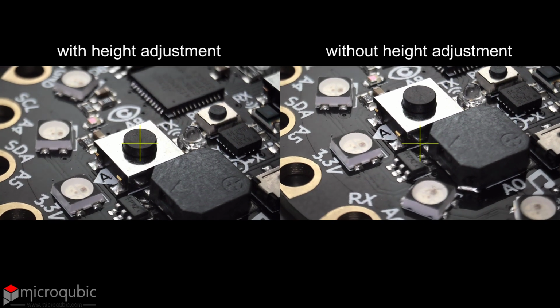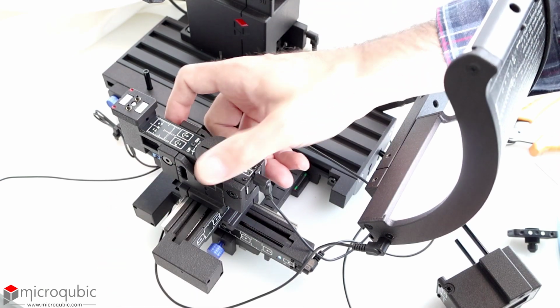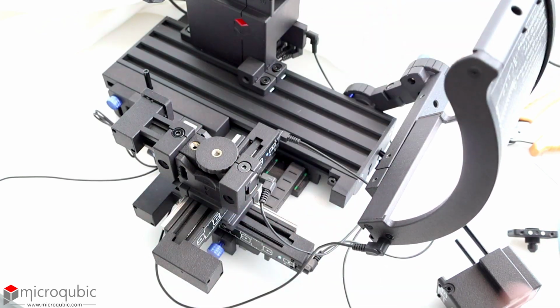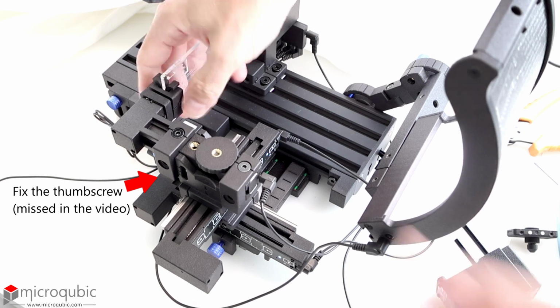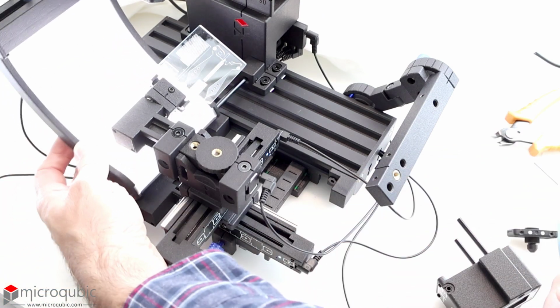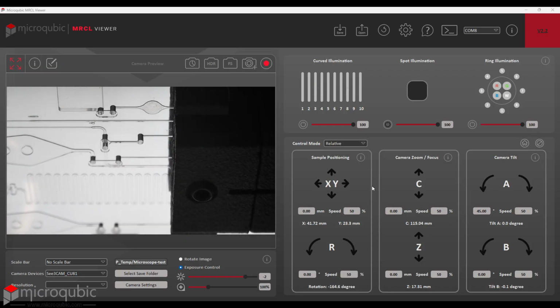For 360-degree imaging, start by pulling out the XY stage. Remove both the thumb screw and the knob, then take out the rotary actuator and reinsert it after rotating it 90 degrees. Height adjustments are not needed in this mode. You can use the provided magnetic adapter to secure your sample. This setup is particularly interesting for transparent samples when illuminated from below, but you can also try it with other sample types and different illumination sources, such as coaxial illumination.